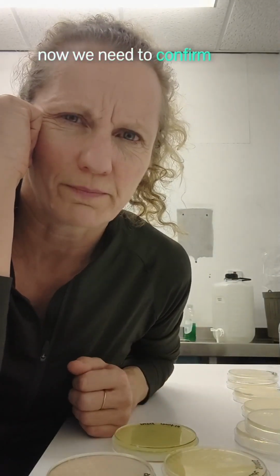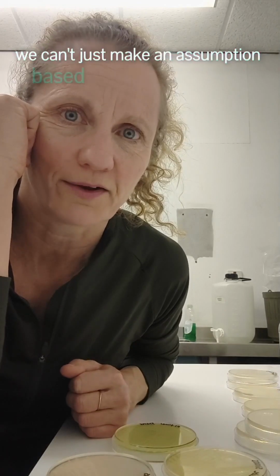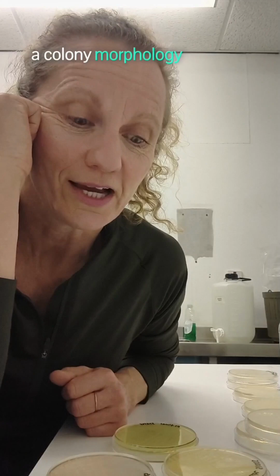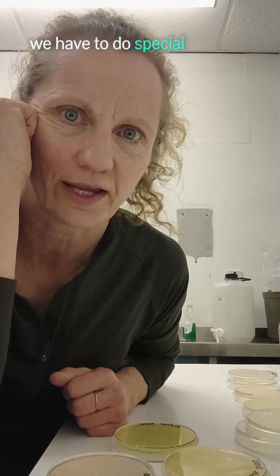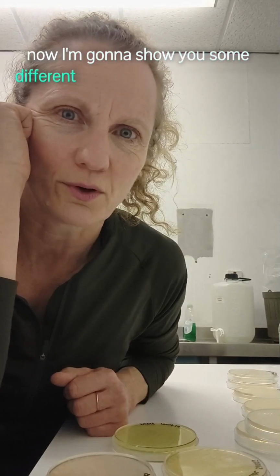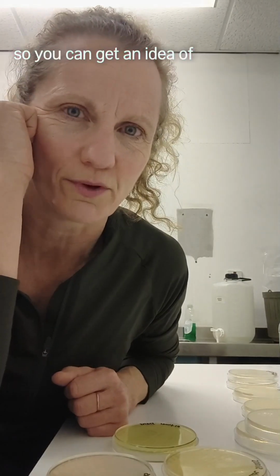Now, we need to confirm the bacterium. We can't just make an assumption based on colony morphology. That's what it's called, the shape of the colony, morphology. We can't make an assumption. We have to do special stains and biochemical tests. I'm going to show you some different colony morphologies here so you can get an idea of what that all means.